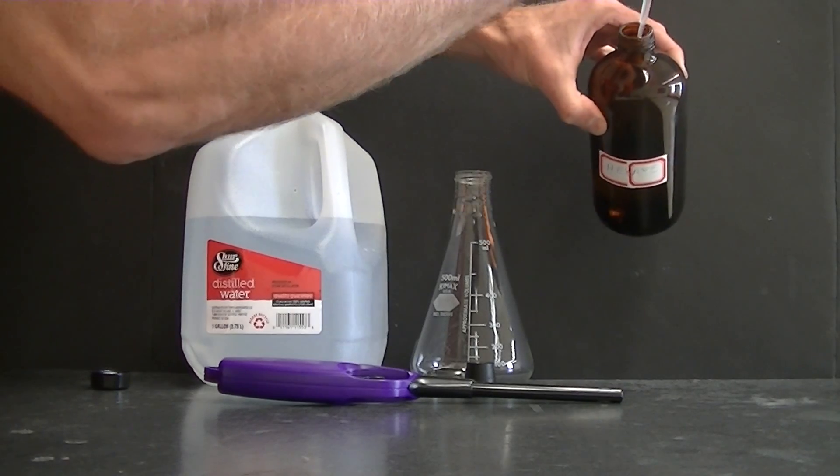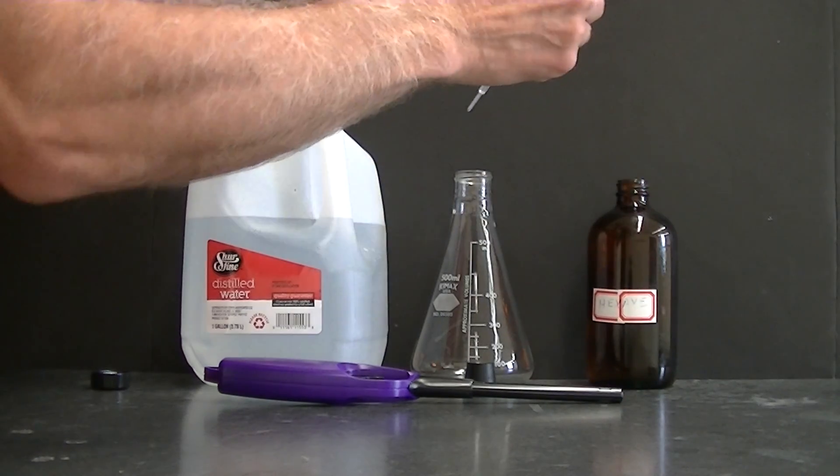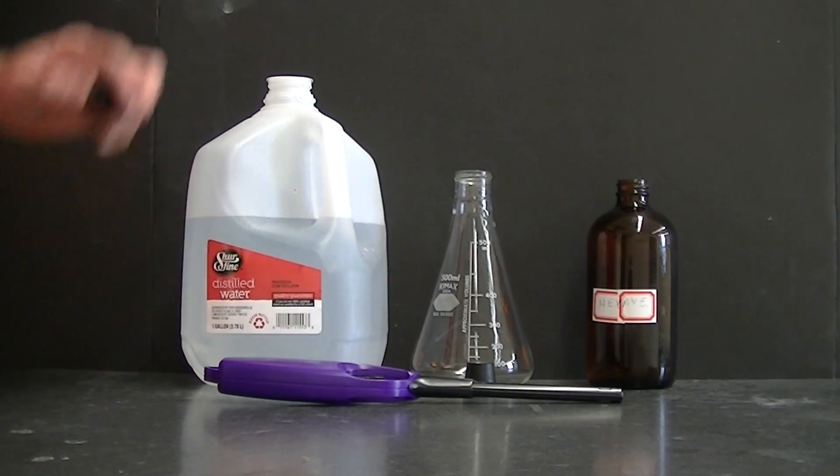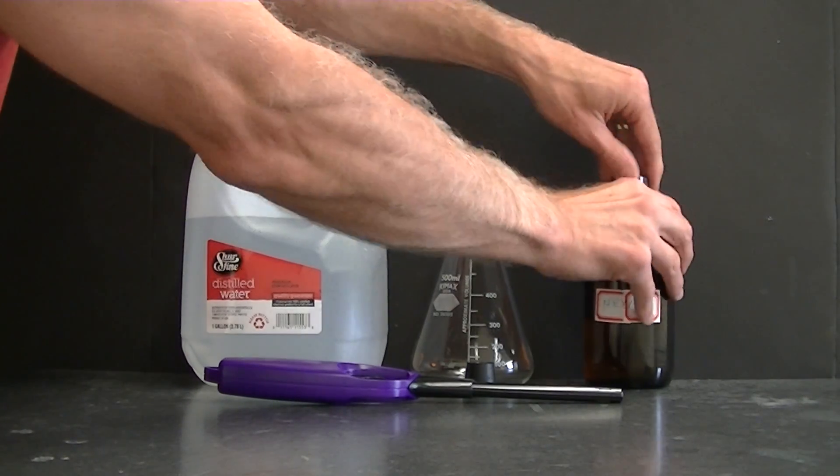I'm going to add a flammable liquid that is immiscible with water and is also less dense than water. That's basically the secret. I'm using hexane.